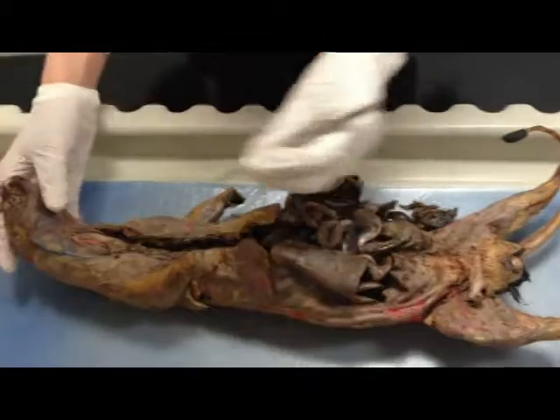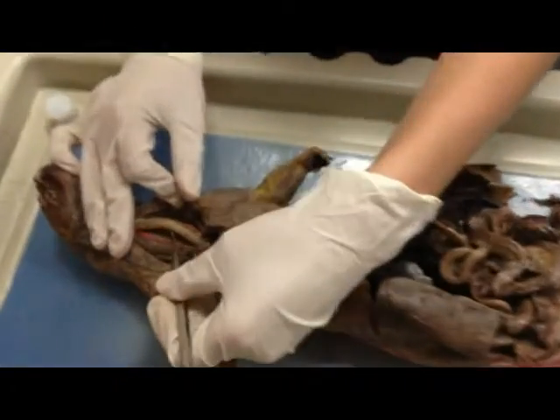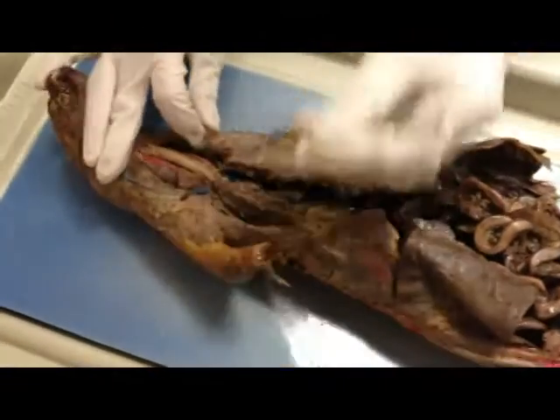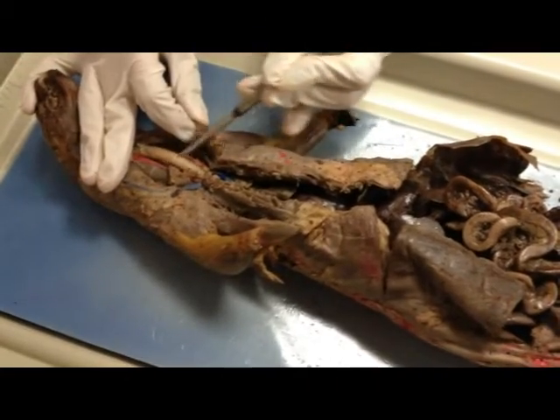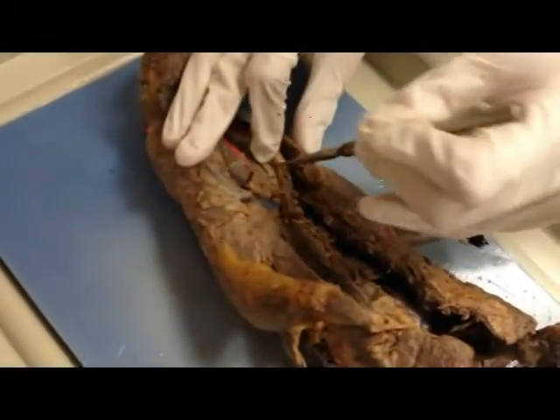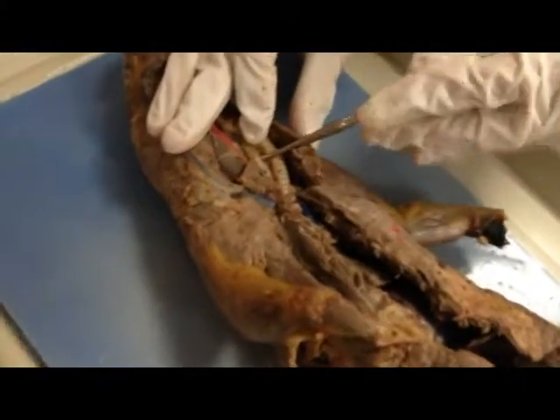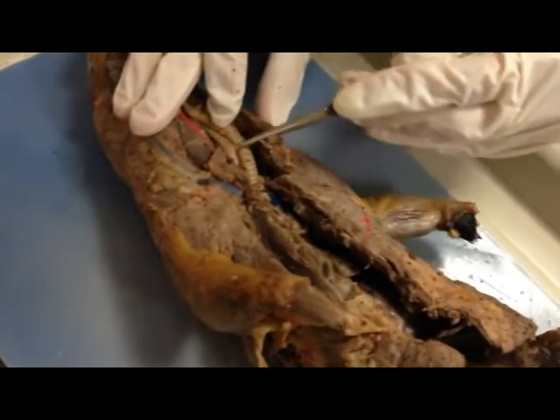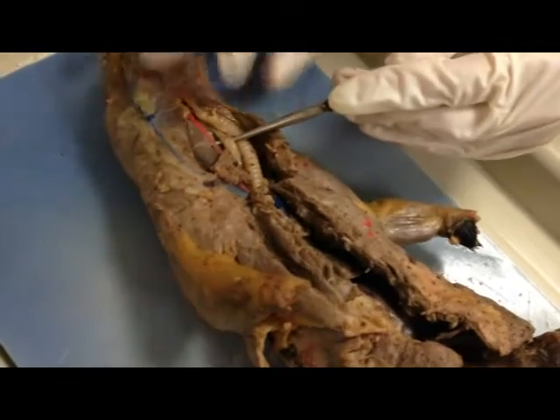So first, of course, is the trachea — this one right here that has a little ridge. Behind the trachea is the esophagus. It's the esophagus, which is behind the trachea.